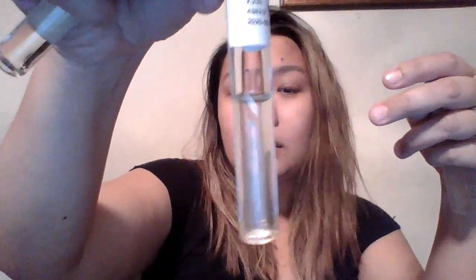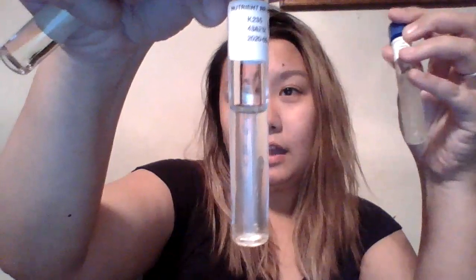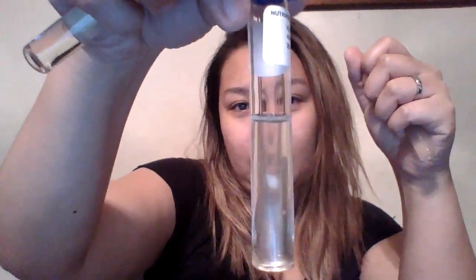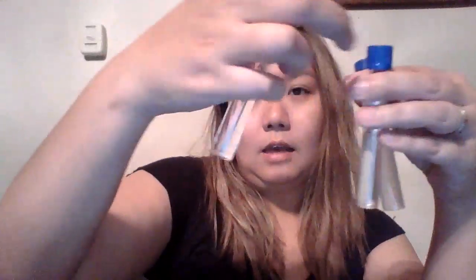The 7%, the turbidity is in between cloudy and clear, but if you look through the middle, there's sediments of bacterial growth. So I think this is a pretty good starting point to grow bacteria. But obviously once you get to the 15%, it's completely clear. So it won't grow under these environments, but it will grow under the 1 and 7%.